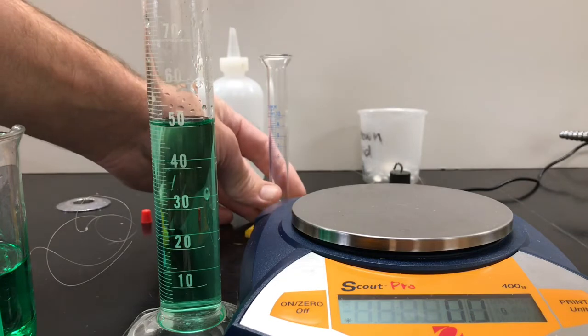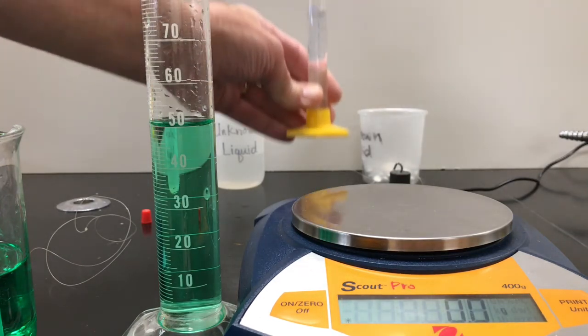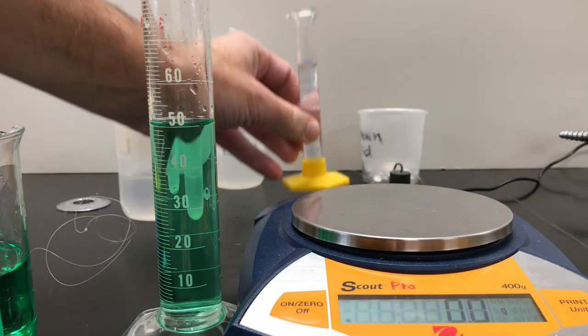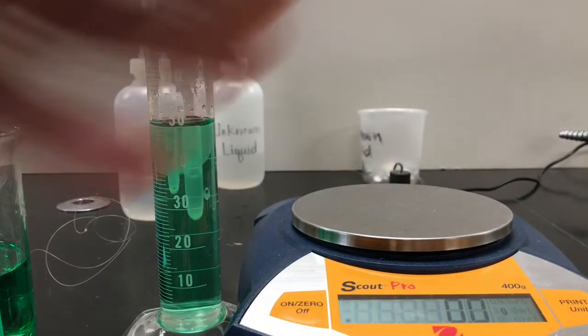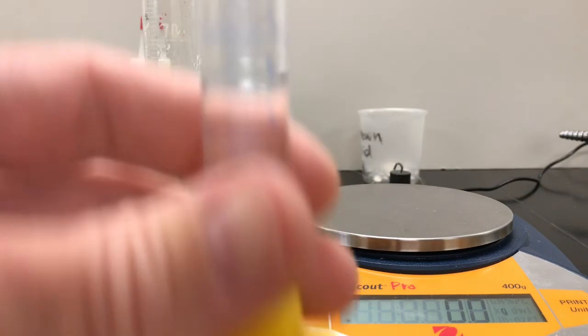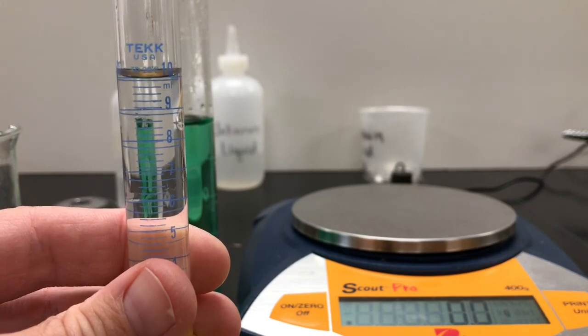And I'm thinking, let's just go max. Let's go all the way to the 10. It's pretty easy to do. Let's look at this. Let's see what the reading is. Did I reach the 10? I'm actually a little over, so let's pour a little bit of this out. Just a little bit. All right. Just a little bit. All right, let's see what this looks like. Okay, we're just about 10 there.